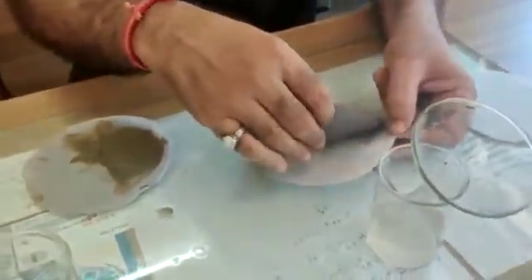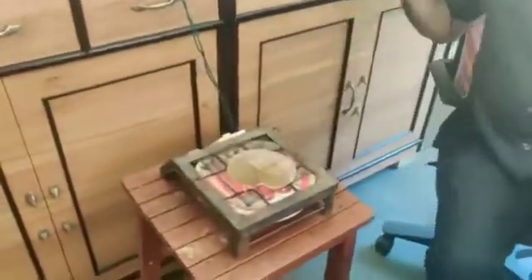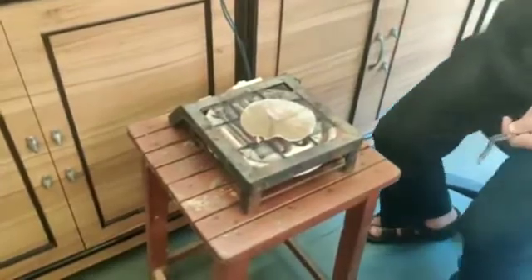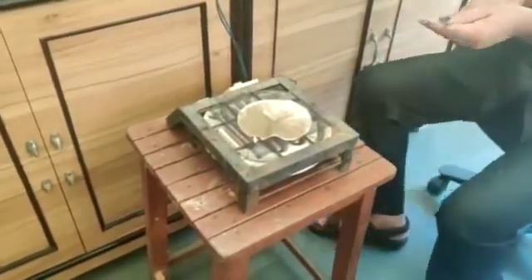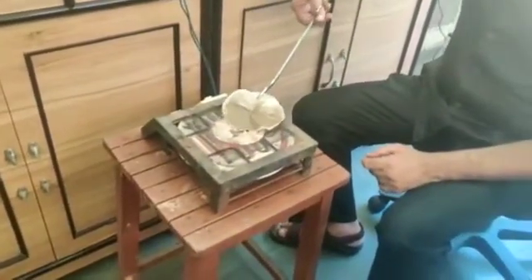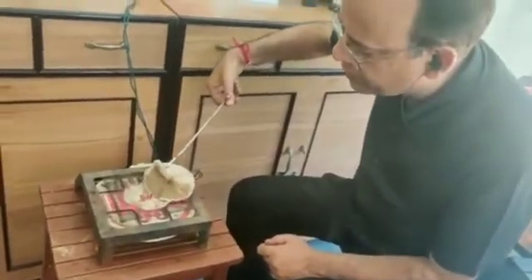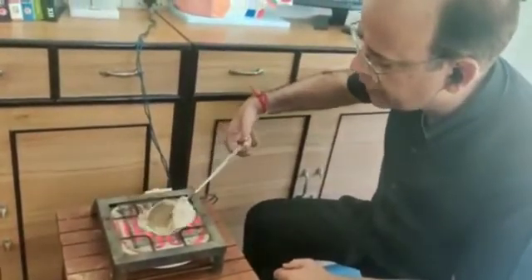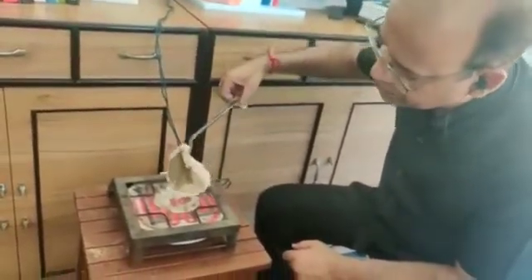Now I am going to dry filter paper A on the heater. Take it carefully and put it on the heater to dry it. Be careful when you are drying it — it should not burn, so provide heat in a proper way. We have to remove all the moisture from this filter paper; only particulate matter should be present. The paper should not burn.